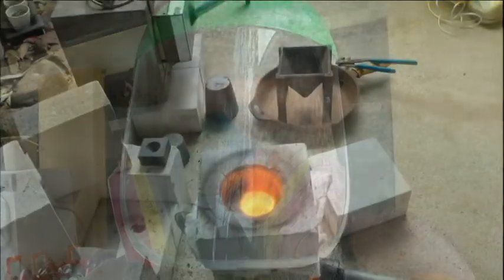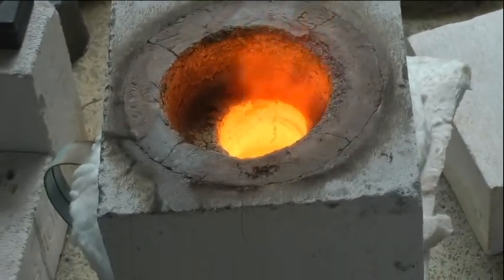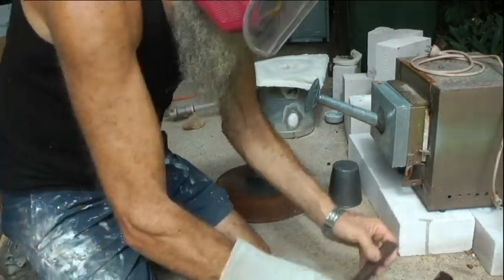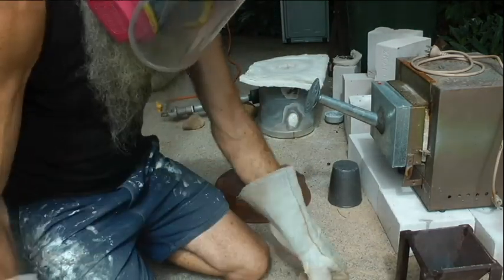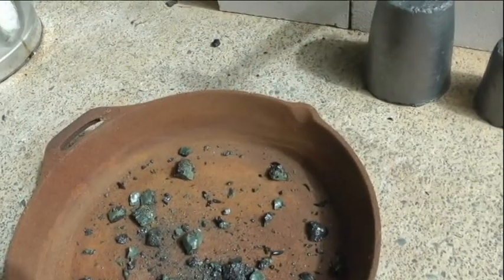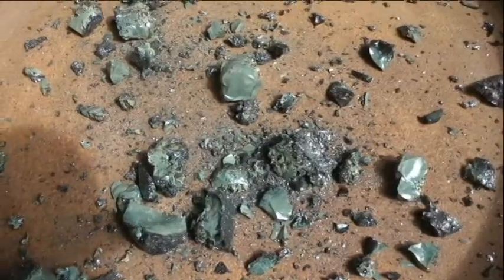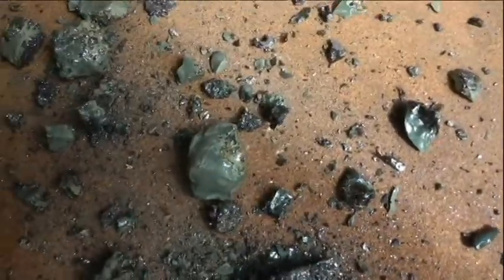Alright, keep going. Cool. The lid. What's that? Weird looking, green looking colour in that slag. What that's all about, I've no idea.